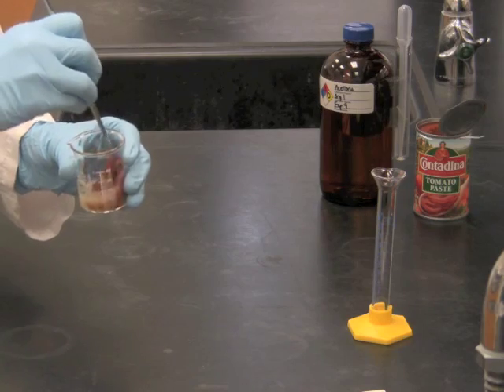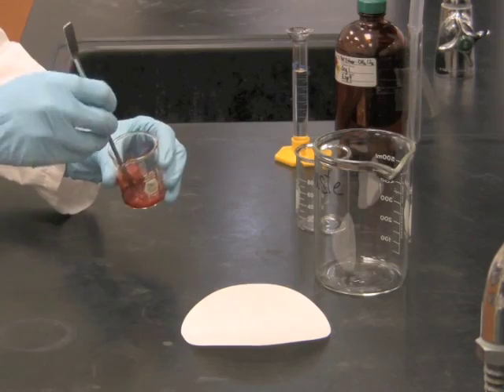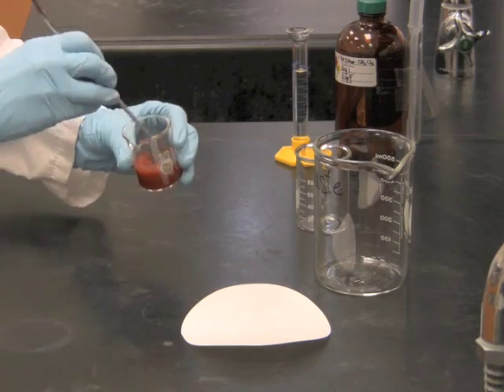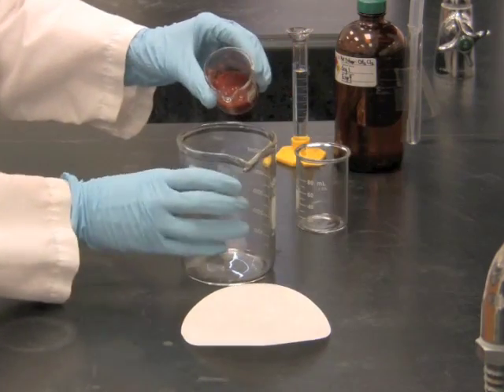Mix that thoroughly to remove all water and water soluble substances from the paste. After stirring for 3 or 4 minutes, decant off the extra liquid.